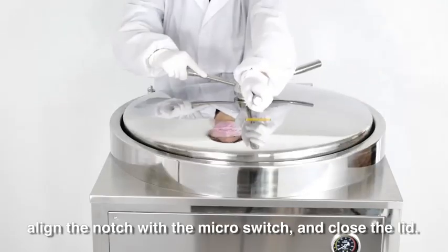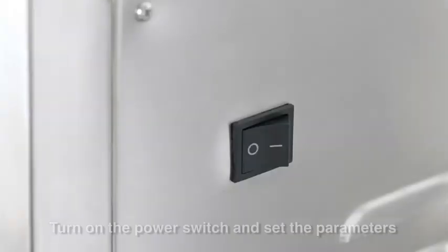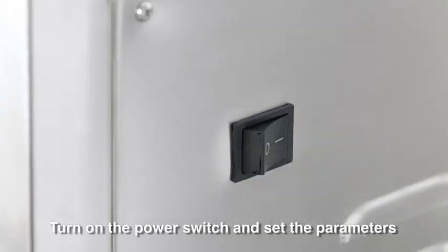Align the notch with the micro switch and close the lid. Turn on the power switch and set the parameters.